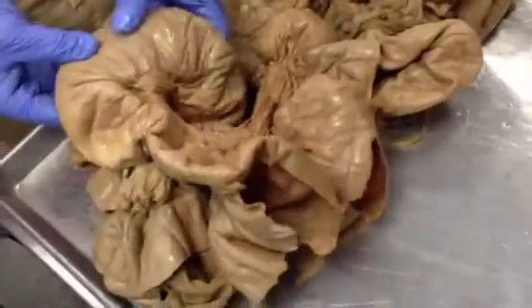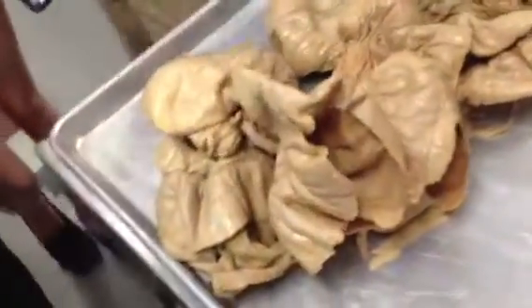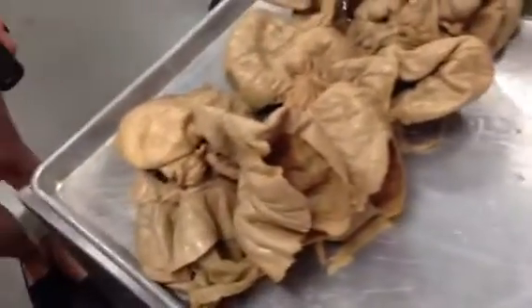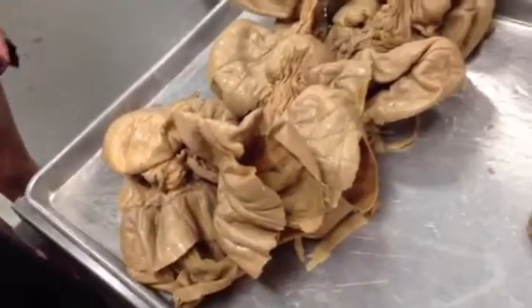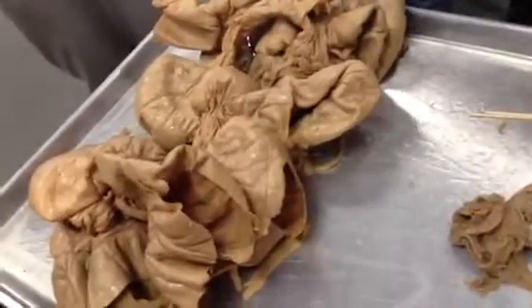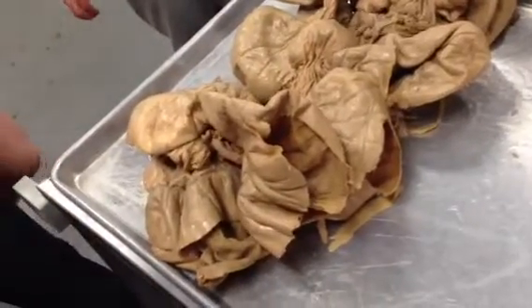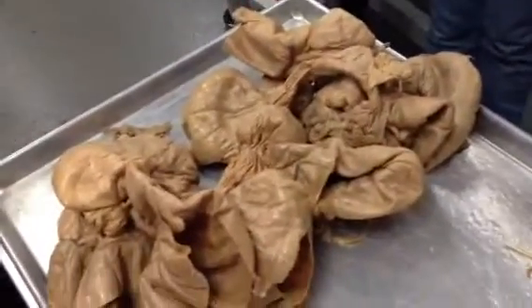It's right here. Cut it open! I've got tons of piglets. Cut it open! Katie, cut it open! You're a science major, right? Me? Yeah. Same thing. Okay. Got to show you the piglet because the umbilical cord, I think, is on the blue sheet.